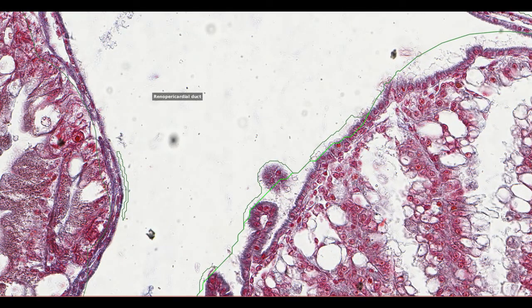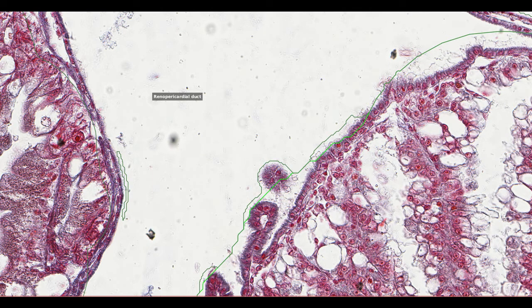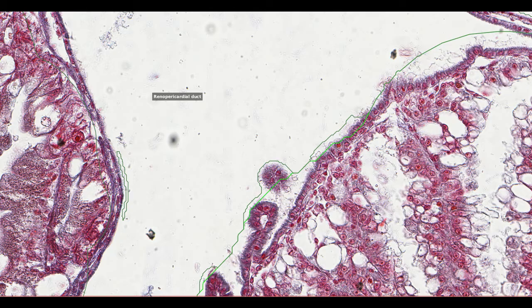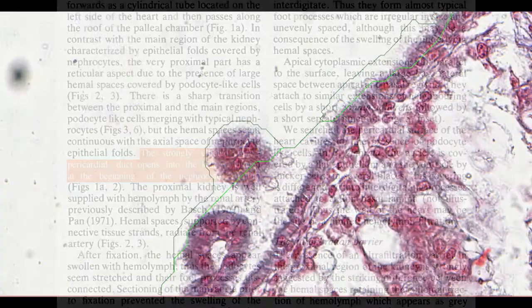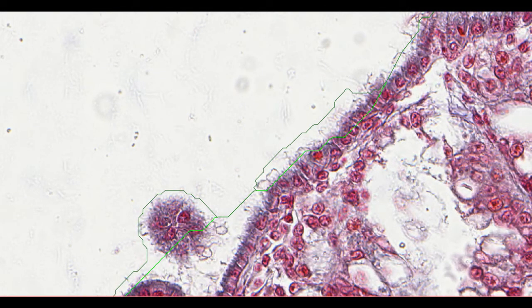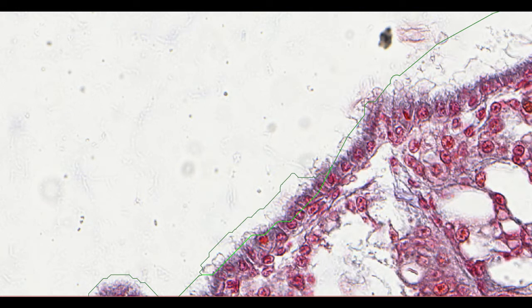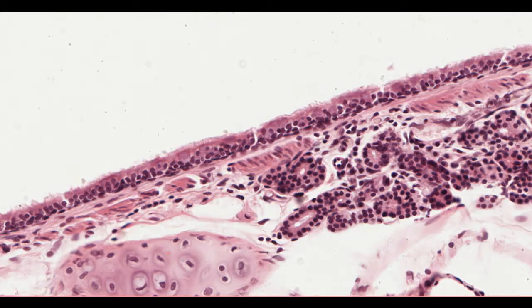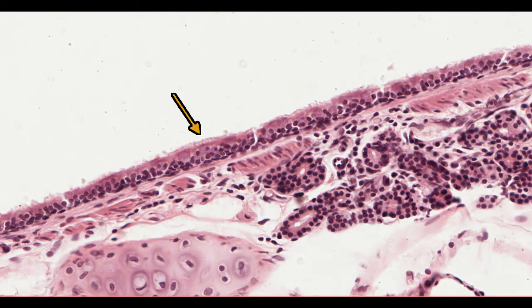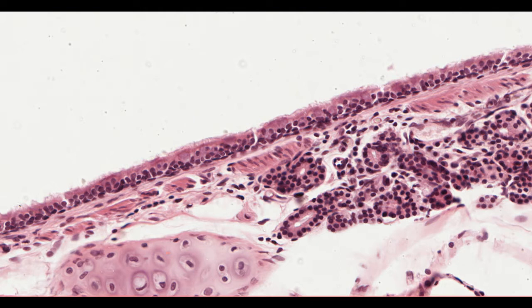Here it is — at least, I think it is. There are no good texts describing what the cells of the reno-pericardial duct look like, and no pictures. One paper describes it as strongly ciliated, and that's exactly what we have here. If we zoom in on the cells lining the duct, you can see hundreds of tiny hair-like projections on the surface of the cells. These are cilia, very similar to the ones you'll find lining larger airways in mammals. The cilia beat rhythmically together to move fluid from the pericardium to the kidney, ensuring a one-way flow of primary urine.